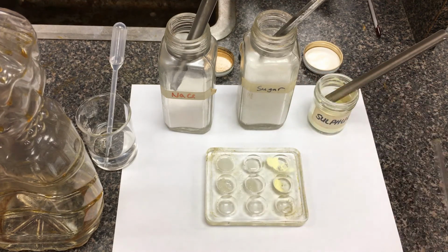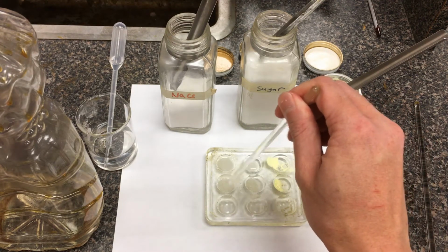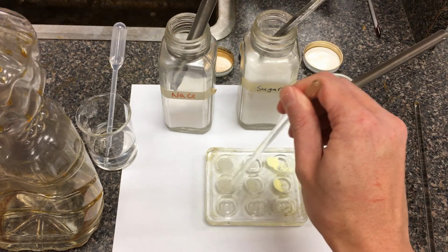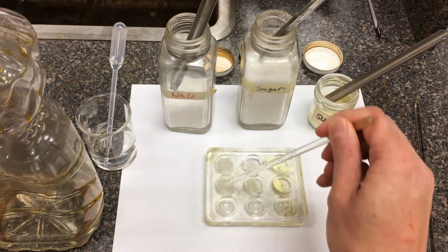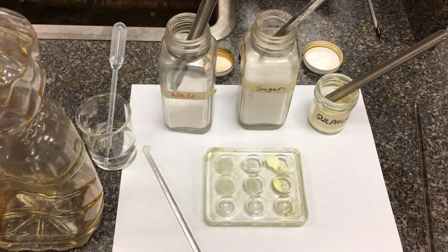Okay. We'll switch over to another glass stir rod here. Let's try the same table salt here, but in oil. Okay. Looks like the oil has maybe evaporated off a little bit, but you still see a lot of crystals of table salt left over. Okay. We can do that as our observation here.